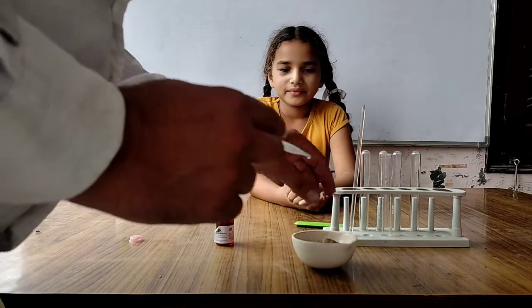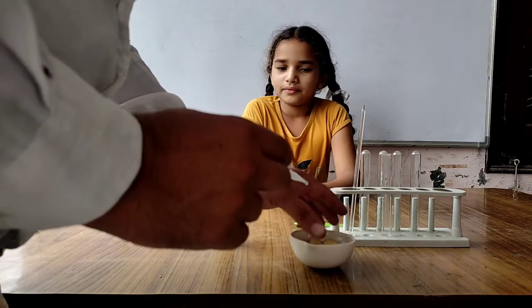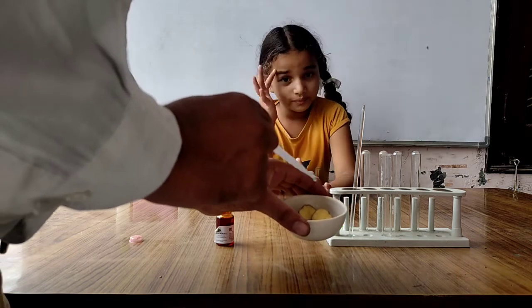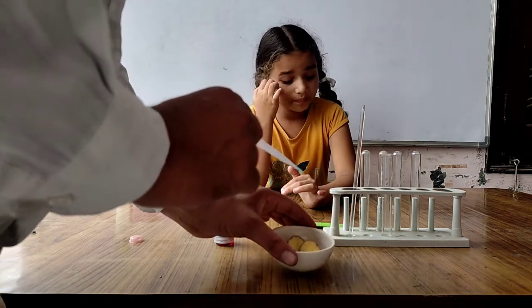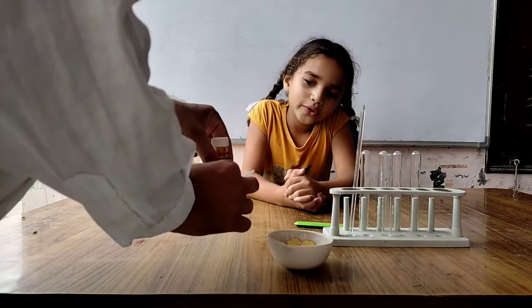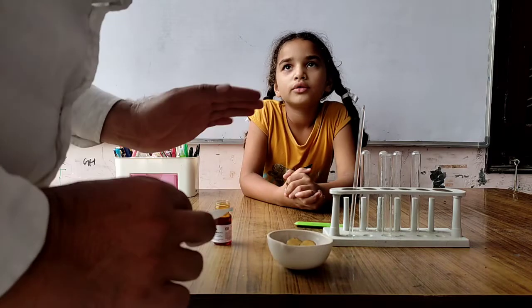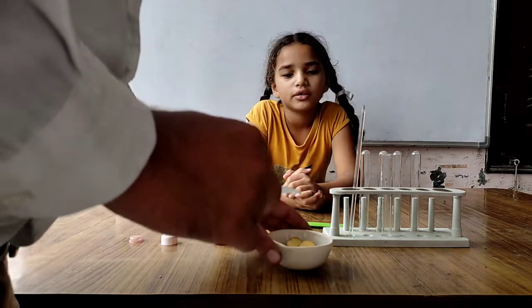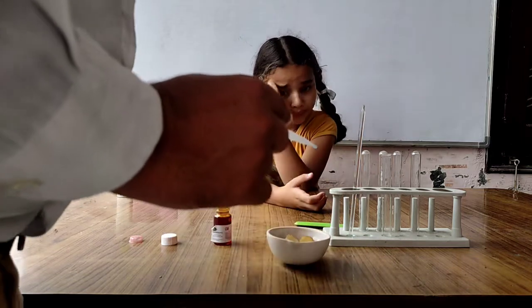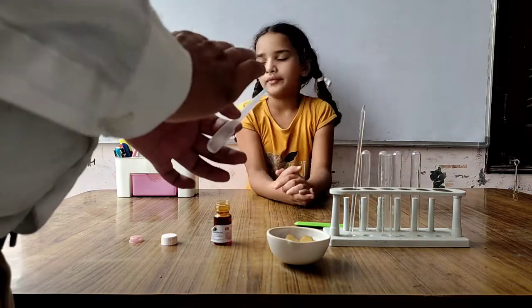I am adding one or two drops of iodine solution on the potatoes. If the color changes into blue or black, that means starch is present in the potato.